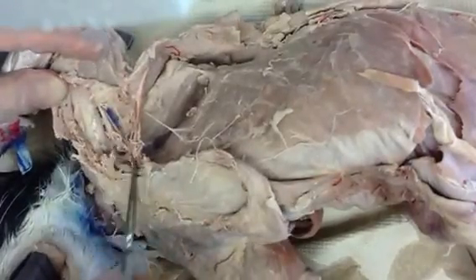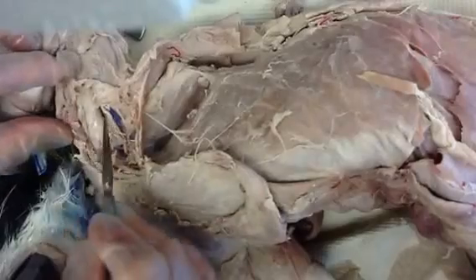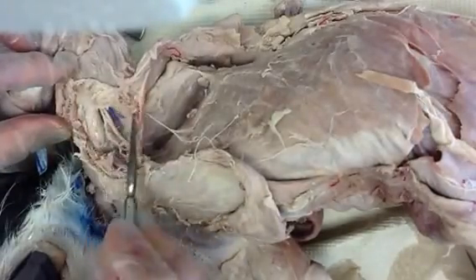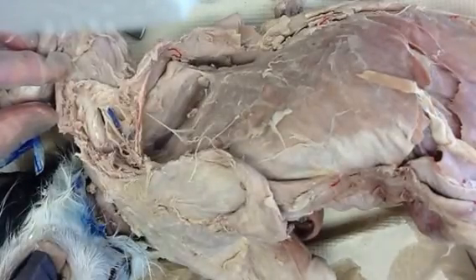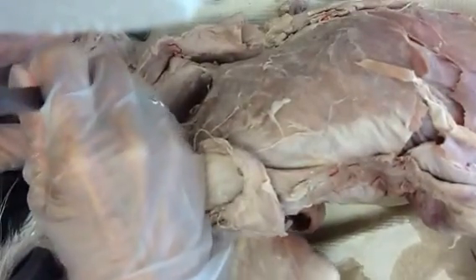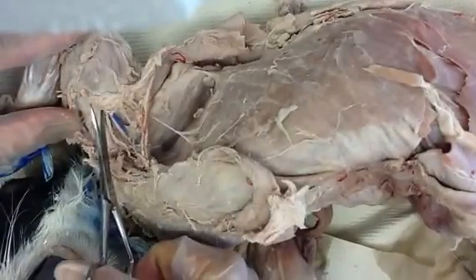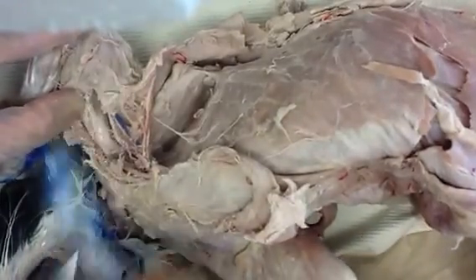You can see in this plexus it's really hard to tell which is which. So the best strategy is, now that you have found this bundle, this braid of nerves, you're going to take your scalpel and slice just a little bit. It really helps when the scalpels are sharp. We'll use scissors instead.